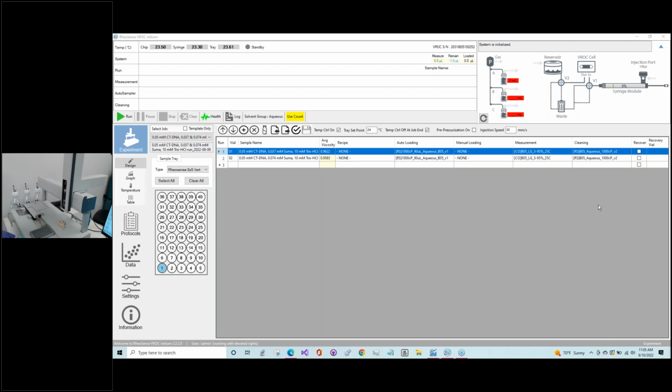So the way we're going to do this is we're going to go over basically the routine that internally all of the scientists and engineers at RheoSense go through on the regular to make sure everything is functioning, and then to address any situation as early as possible. So this is kind of how we come in when we start the day and start our procedure before we do any testing.